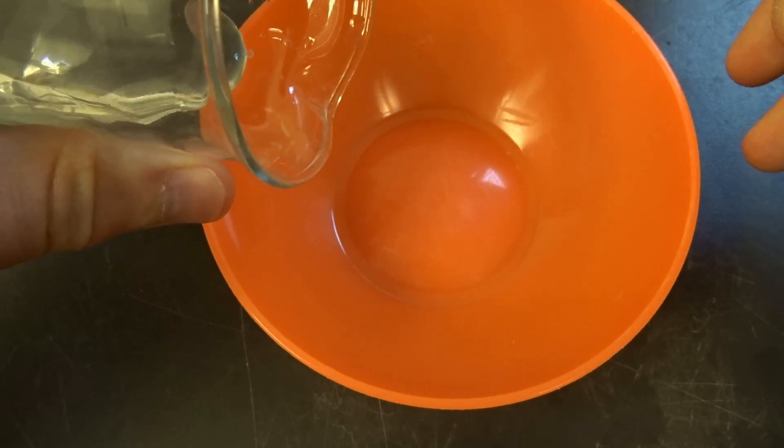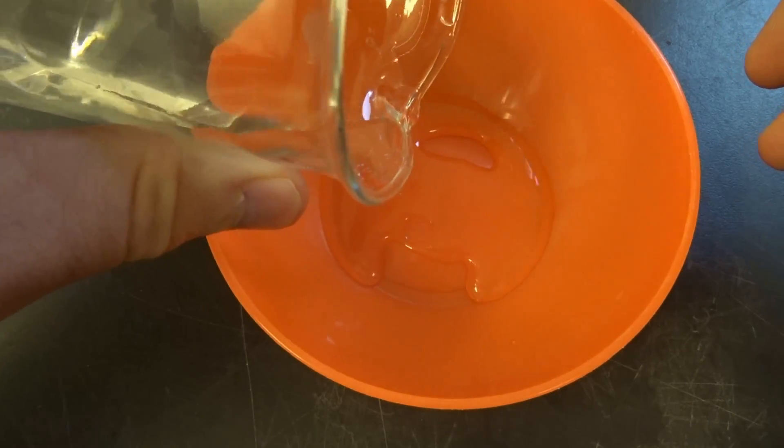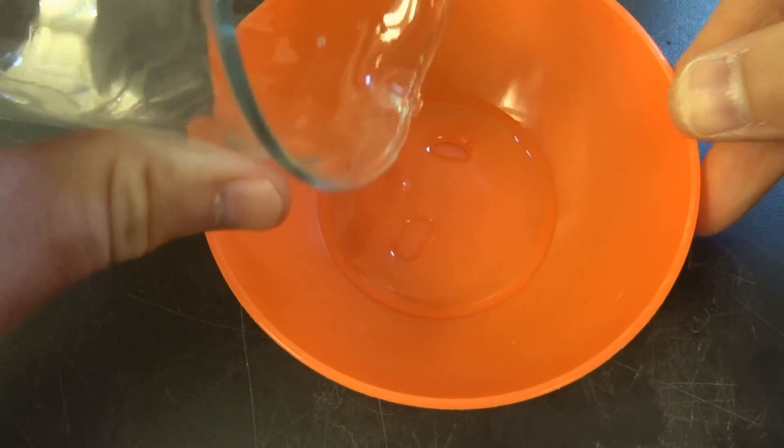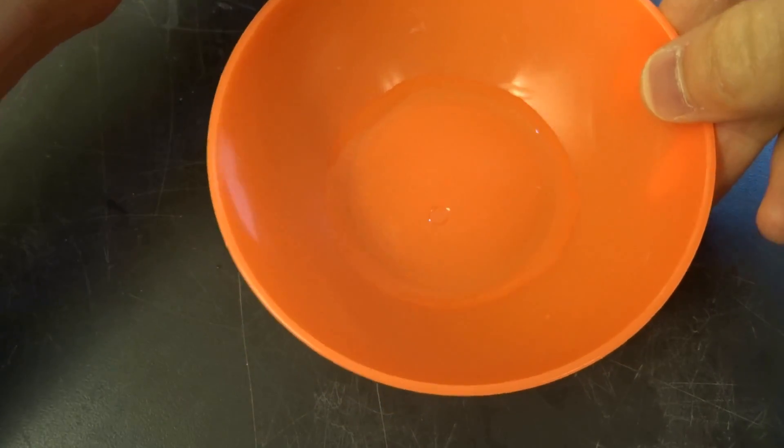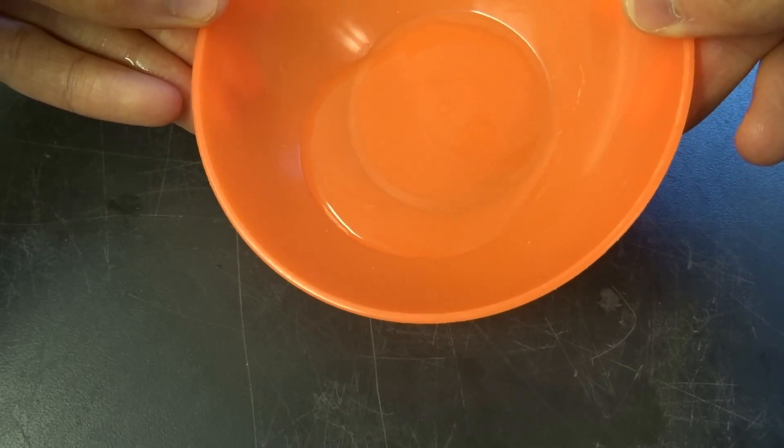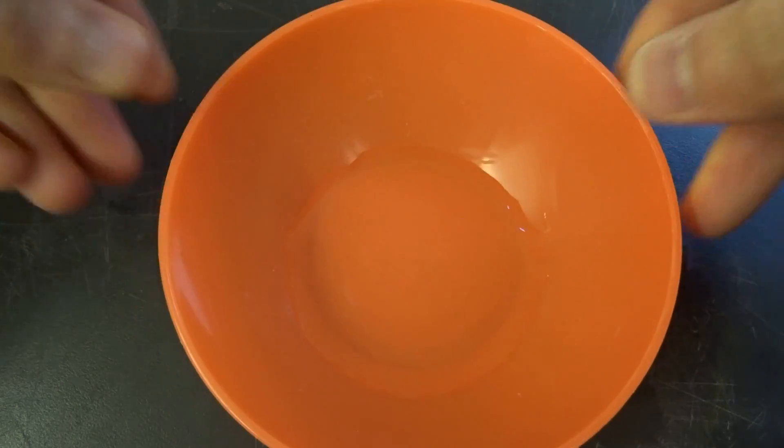So I'm going to add some sodium silicate. This is actually the most convenient reactant I've found. It's just pretty cheap, you get in every hardware store in 5L jugs and jars, and I added a bit always that the bottom of this thing here is covered, so it's approximately 15 to 20 mils or so.